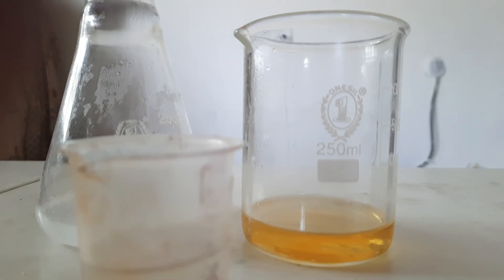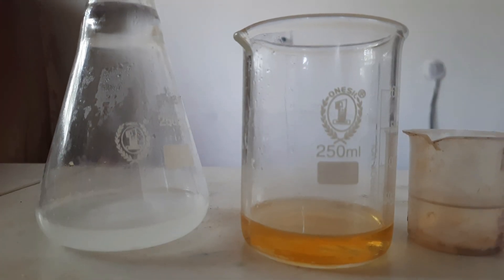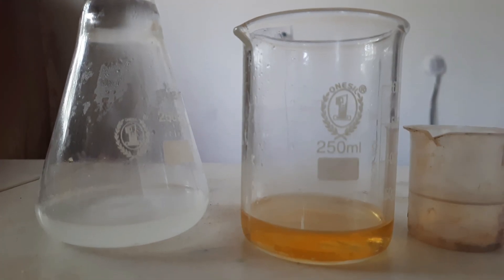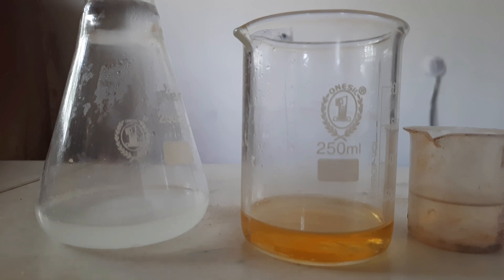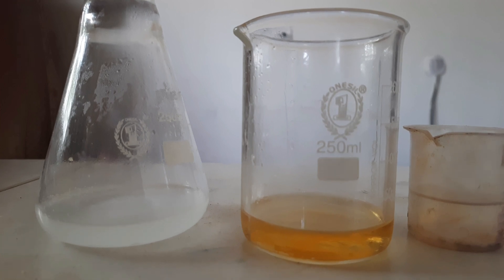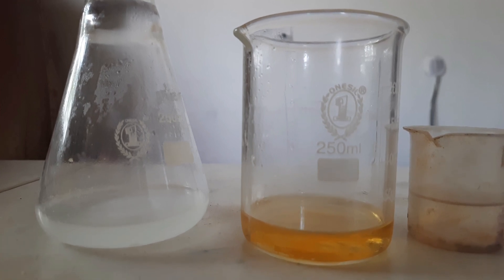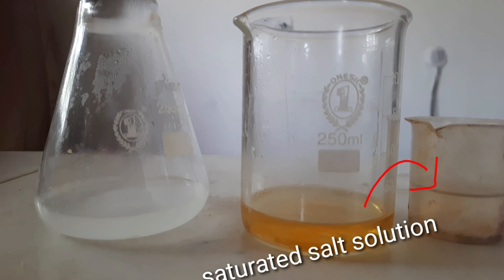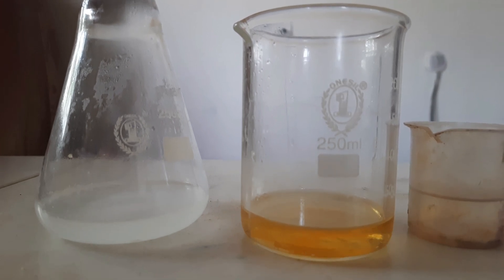We also need some saturated sodium chloride solution. We use the sodium chloride solution to salt out the soaps, because it helps in precipitating the soap, so that we get both things separated — glycerol as well as soap.